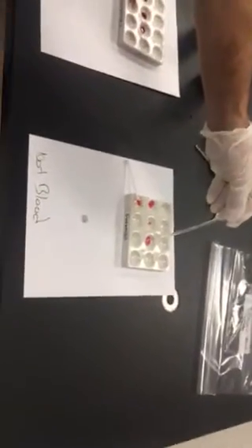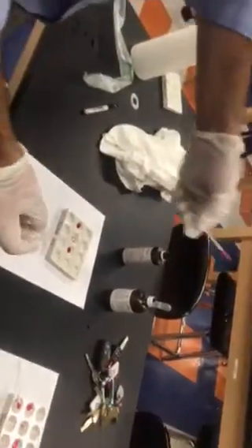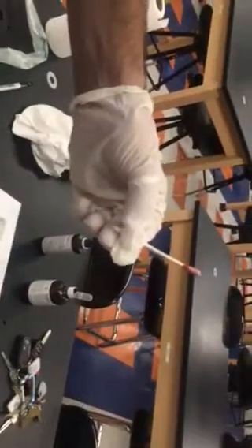I'm going to do the same test to one of these wells, add a few drops of Kastle-Meyer, and a few drops of peroxide. All right, and we'll let that sit. Now I'm going to come over to where I have blood. This is chicken blood, so I'm going to add a few drops of my Kastle-Meyer reagent. We can already see a change compared to the Q-tip that is not blood. When I add the peroxide, we get a very obvious change that did not happen when there was fake blood.